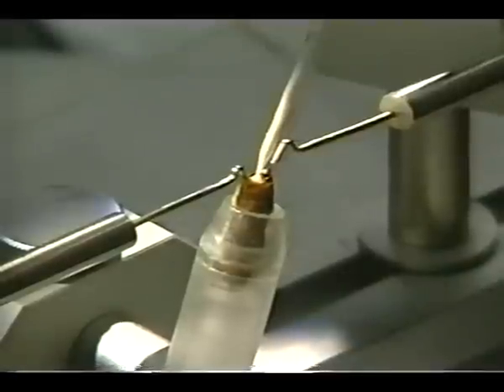Use the saline solution to test if you're in the right location. If the saline goes in, then we're going to continue on and deliver the semen. Here you can see the semen going into the queen. We'll give her about eight microliters. You want to back off slightly; this will cause the tip to come out very nice and clean.